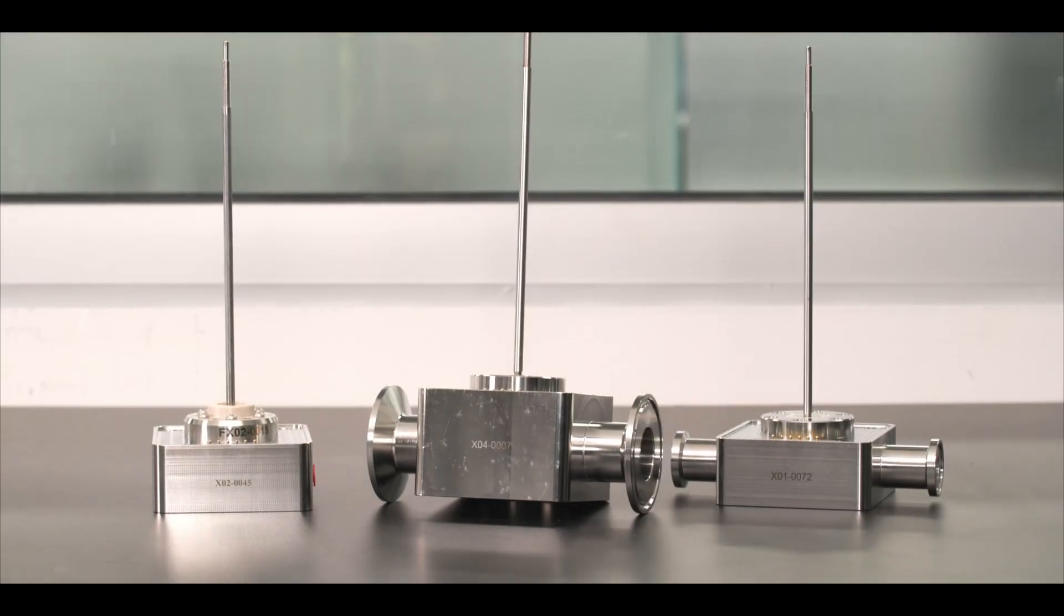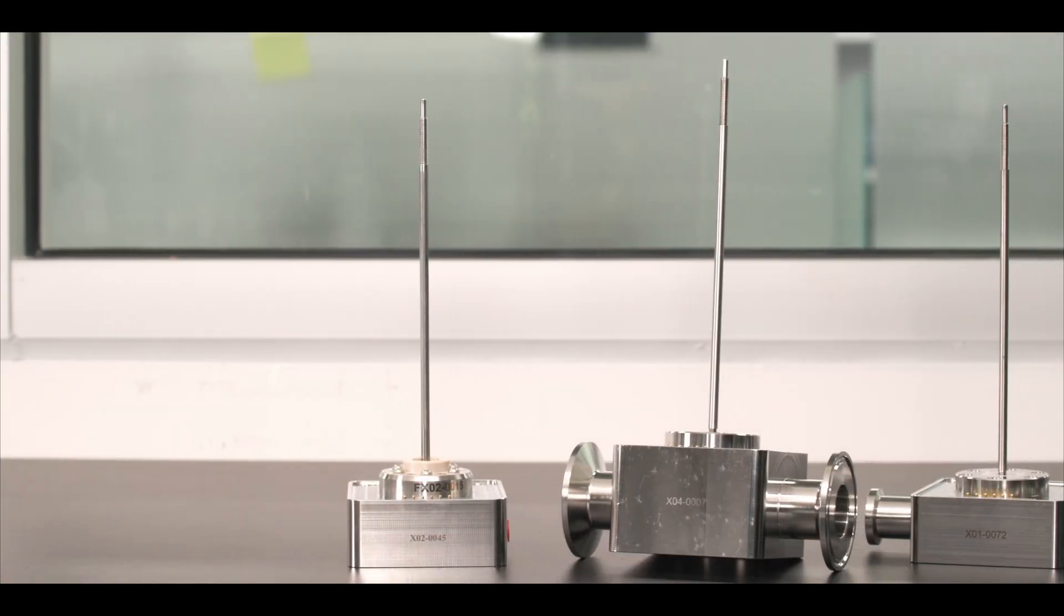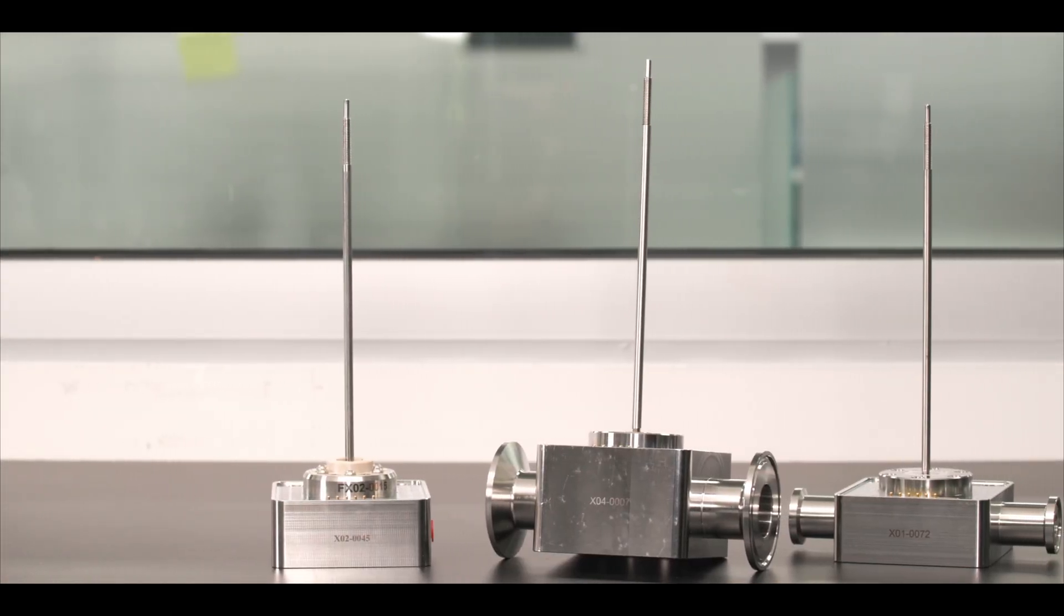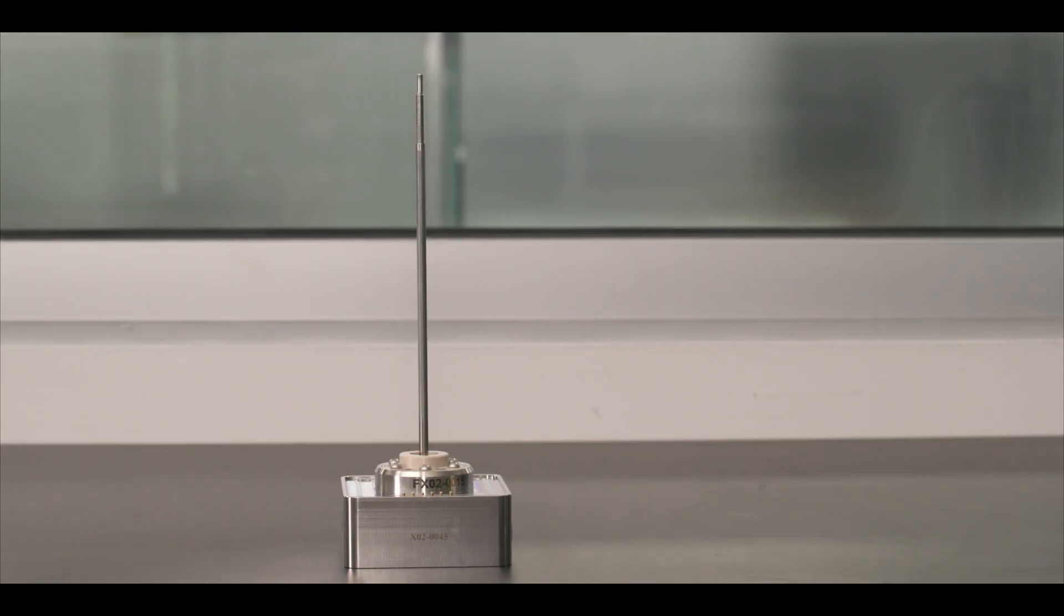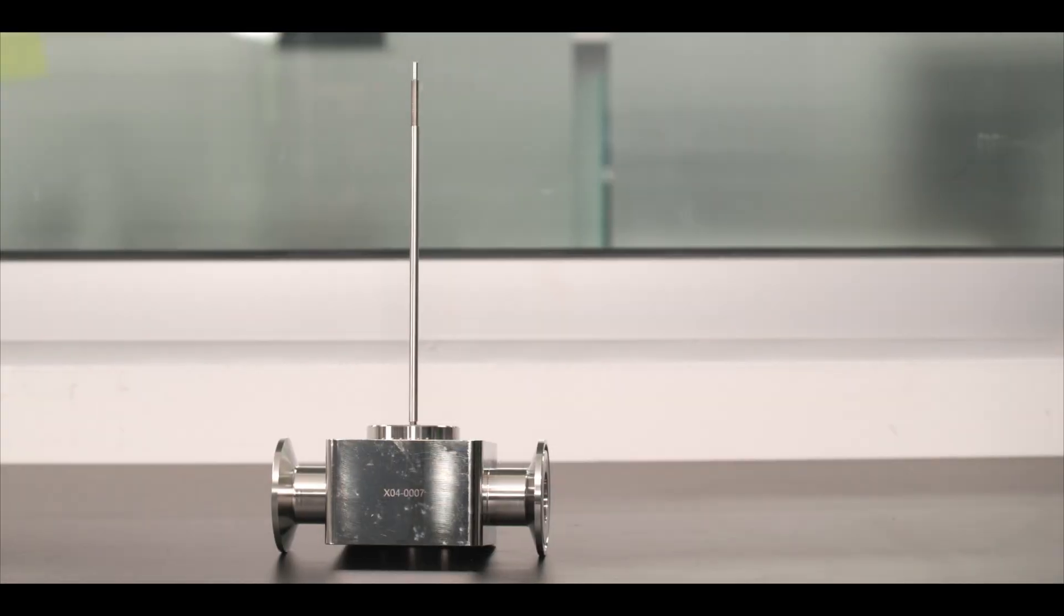To scale up to your process, we provide several flow cells of different sizes and uses. There are the reusable stainless steel flow cells available in 3, 10, and 22 millimeter flow path sizes.